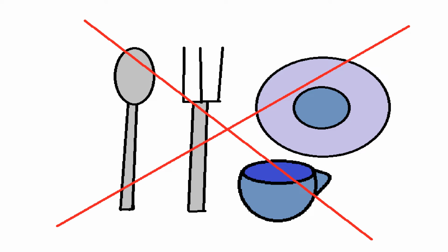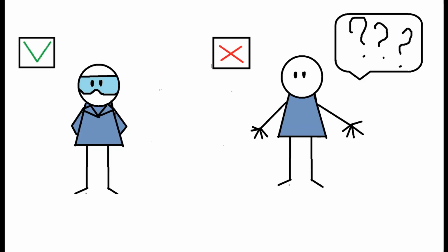That spoon wasn't made for the experiments, it was probably too short, the handle was too large, which is why the person made their third mistake, touched hot metal surface with bare hands. In the perfect world they should probably put on heat-resistant gloves which would have protected them. The fourth mistake was a complete absence of face protection.